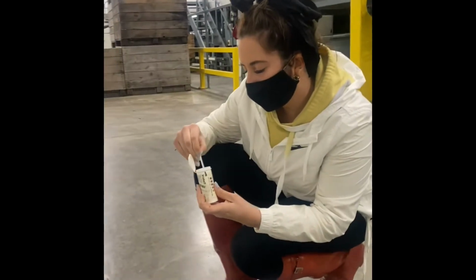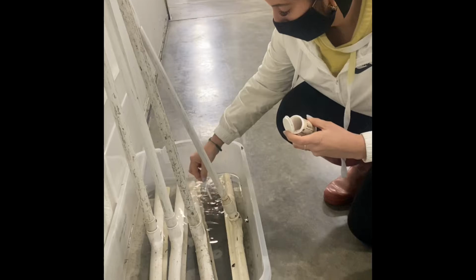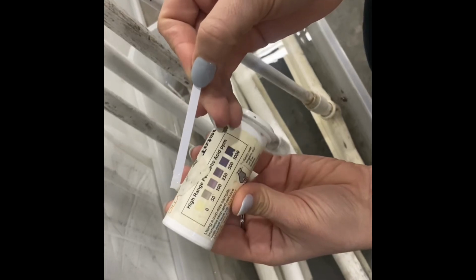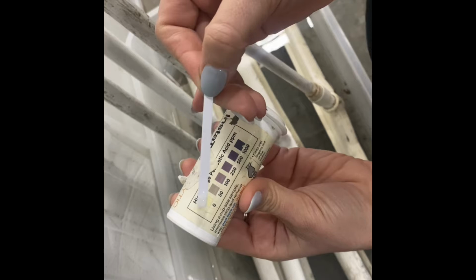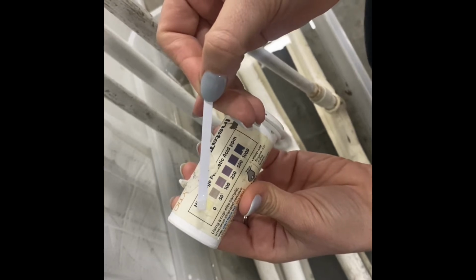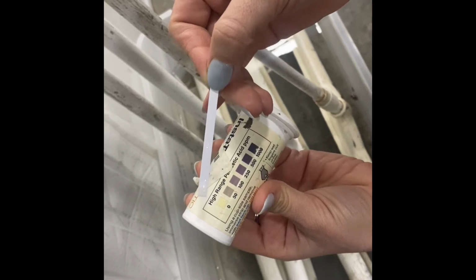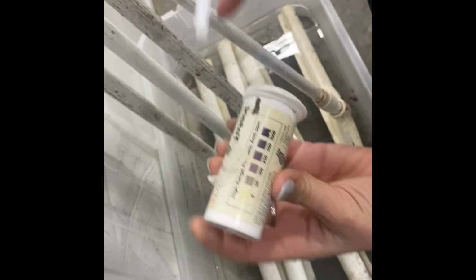Here I am taking a sample of a tote with sanitizer in it that holds our sanitation tools. In this first video, I am showing you a test strip. So I'm testing the PAA in this tub with a strip. It's not as close as the titration, but it very well will tell you the results. So as you can see, there is 0 PAA left in this.